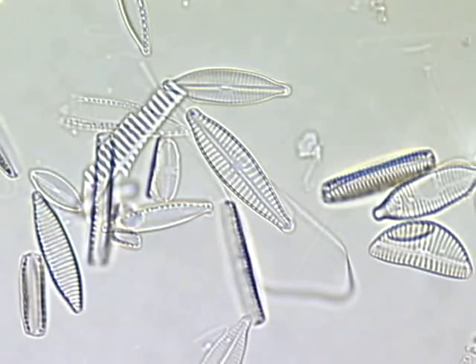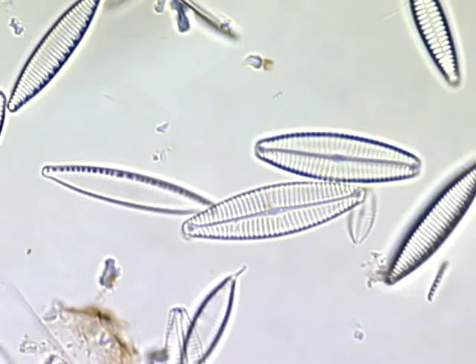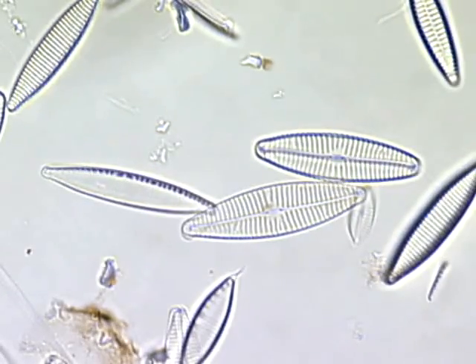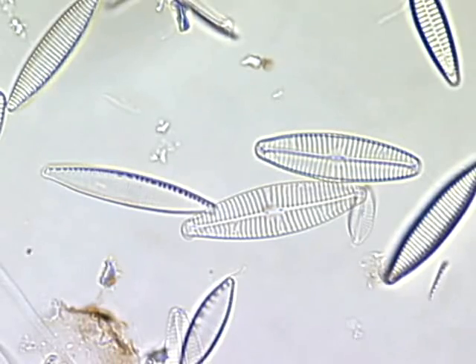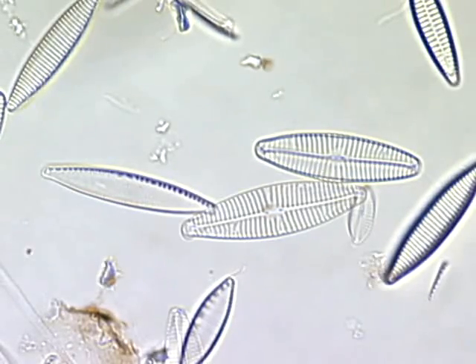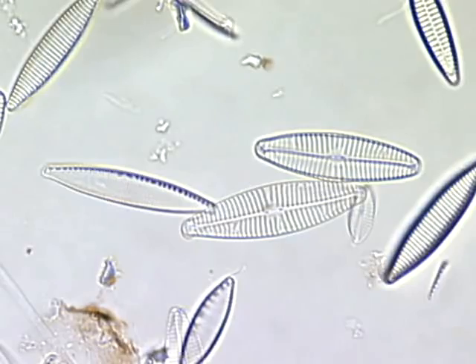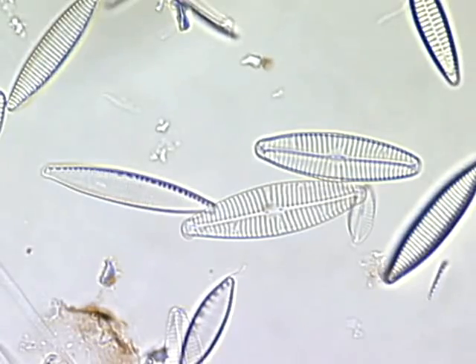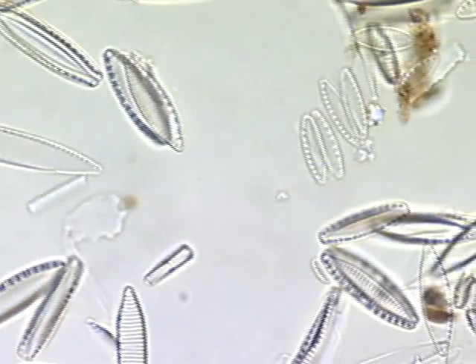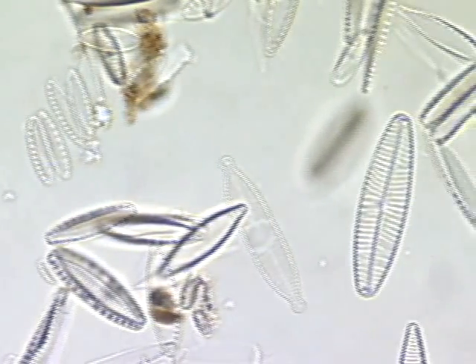These diatoms were collected from a river, cleaned, and then mounted on a slide. It is easier to make observations of the diatoms because most of the debris has been removed. Now the patterns of the shells can be seen clearly.